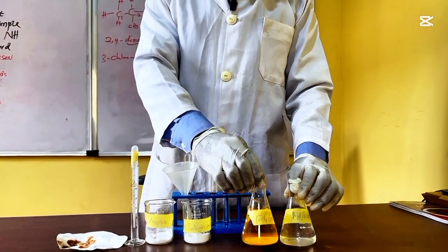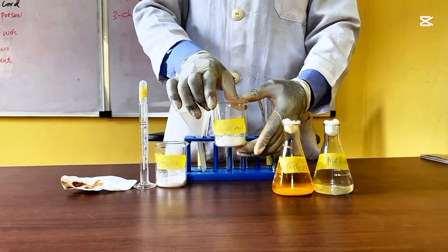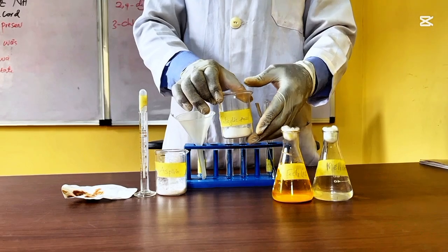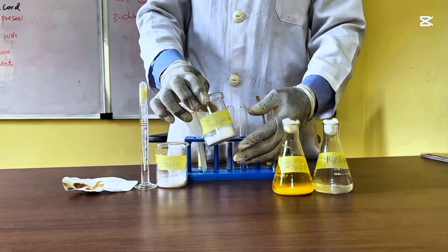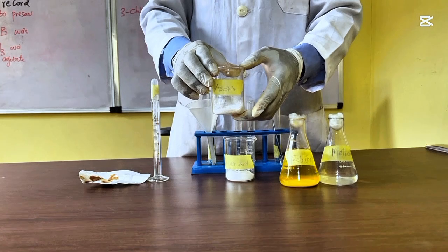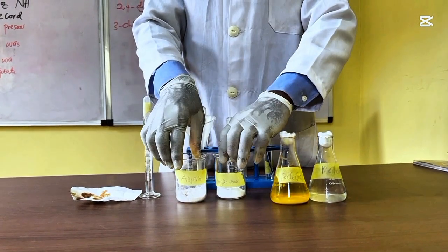So with that, you can know that there is a presence of phenol in your sample. Remember, we are testing for the impurity. And the impurity we're talking about here is the major ingredient of this aspirin, which is salicylic acid. And salicylic acid contains phenols. For samples, you have your salicylic acid, and you have your aspirin. This aspirin is the one you have already synthesized in the lab, and so that's your sample.